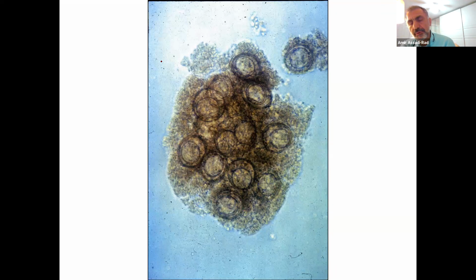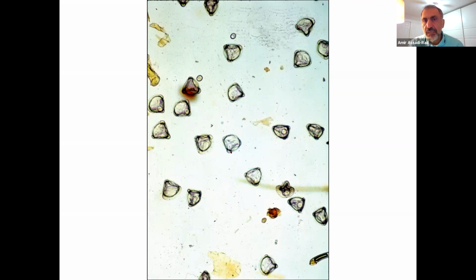And this is the dog's, you know, a student brought some rice grains, and you have the picture of it. I took one of those rice grains from the tail of his dog and put it on a slide, and I put a cover slip with some water underneath, and I pressed it, and I took these pictures. So each one of these can become a Dipylidium caninum. It's called a cluster of eggs found in proglottids. Very unusual in the animal kingdom.